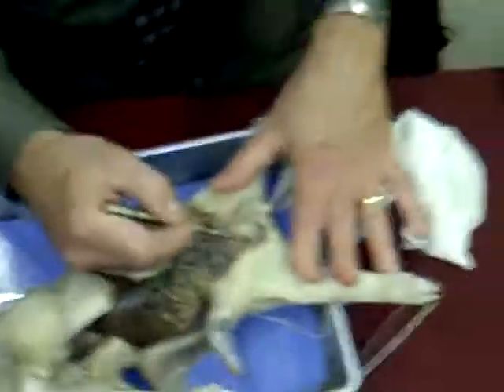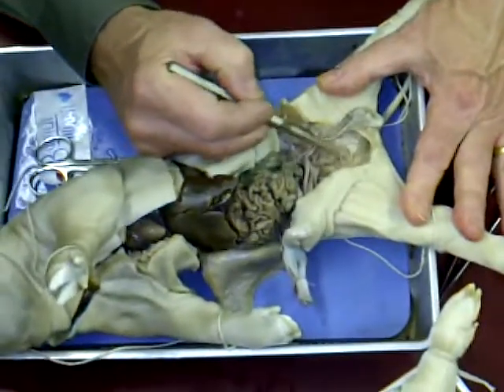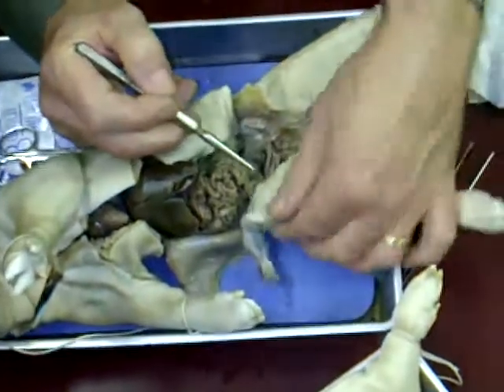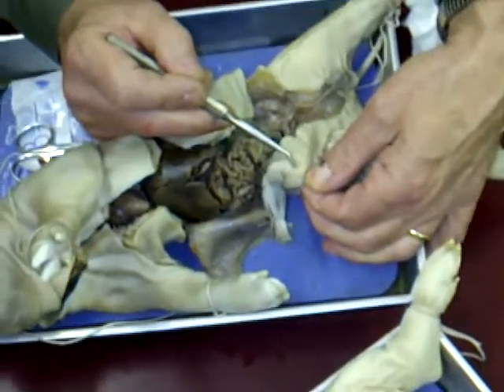Again, from the urinary bladder, trace the urethra going down through the pelvic cavity, and then it comes up around the pubic bone. You see this tube here? That's the urethra, looping back up, and it goes underneath the skin, and it opens right there, below where the umbilical cord is.